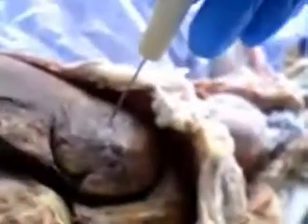These are the abdominopelvic organs of my cat. First, starting with the diaphragm right here above the liver. We've got it right here, and it separates the abdominopelvic cavity from the thoracic cavity. Next, right below that, we've got the liver. We've got the four lobes of it there. There's one, there's two, three, and the fourth. And then down the center, separating the right and left lobe right there, is the falciform ligament.